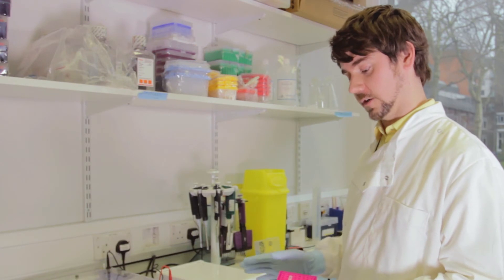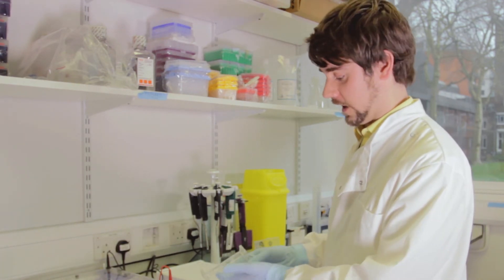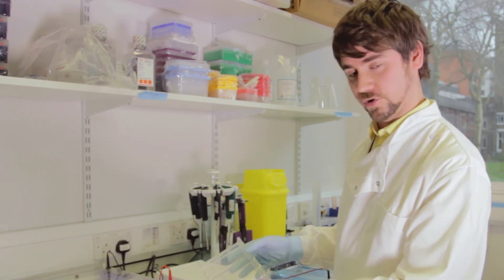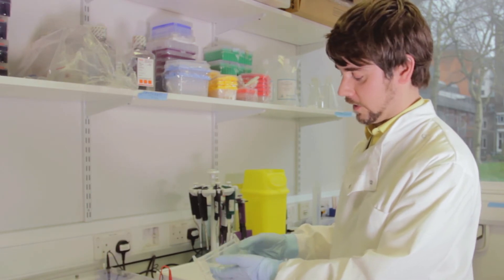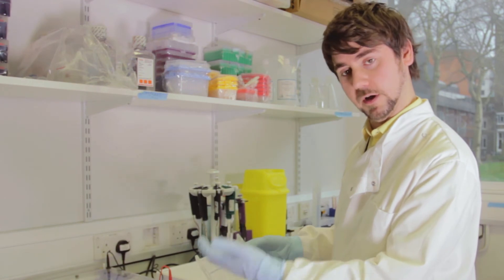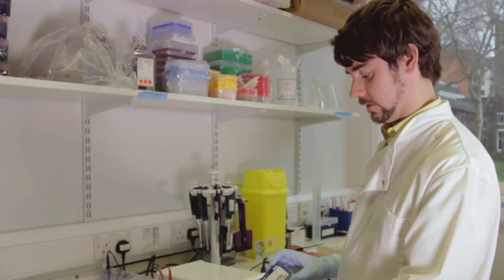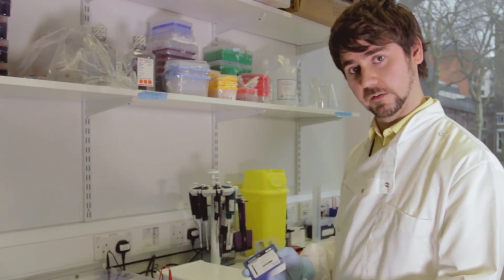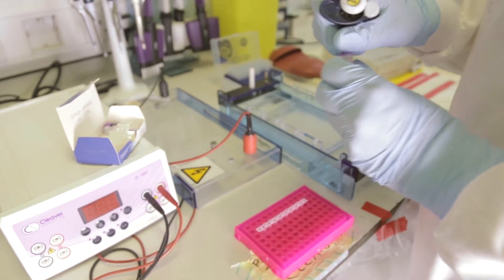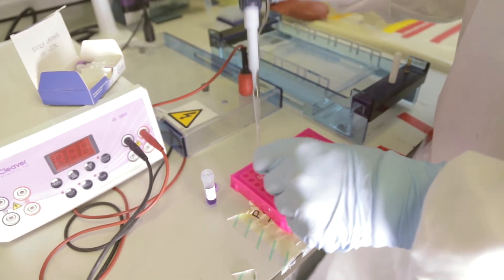Before we do the sequencing we need to check that the PCR reaction has worked using gel electrophoresis. This uses a gel bed where we add some PCR product and run it through an electrode. The electrical current attracts DNA molecules, and because DNA is negatively charged it gravitates towards the positive end. As it passes through the gel, which contains ethidium bromide, that dye binds to the DNA and we can then visualize it under UV light. We also run a DNA ladder alongside the PCR product to size the DNA fragment. To load the PCR products onto the gel we use loading buffer, which contains glycerol that pulls the PCR product to the bottom of the well.